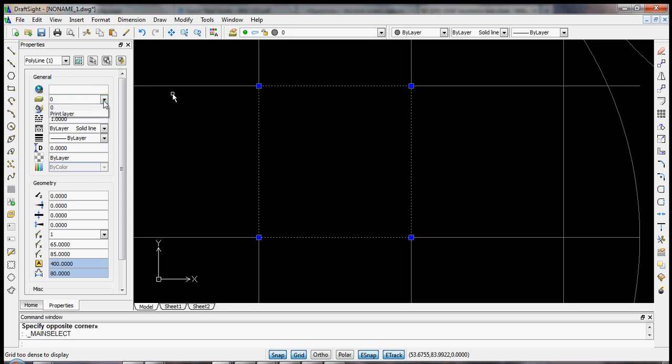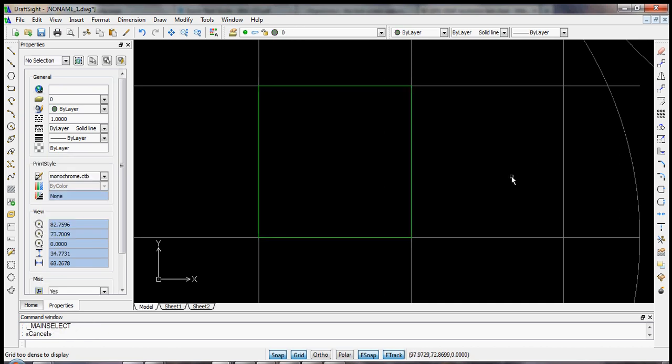print layer. So we can do that down here. We can select print layer and escape. And now you see it turn green because now it's on the print layer. Now, up at the top you see this bar that has the layer, print layer, and a couple of icons. You can lock it, you can freeze it, or you can display it.